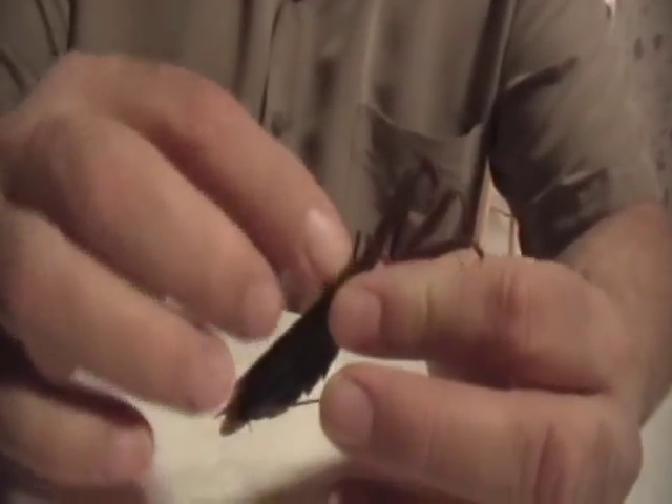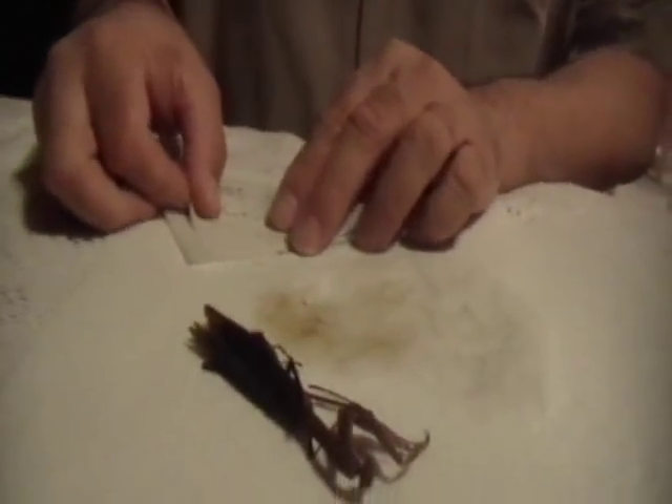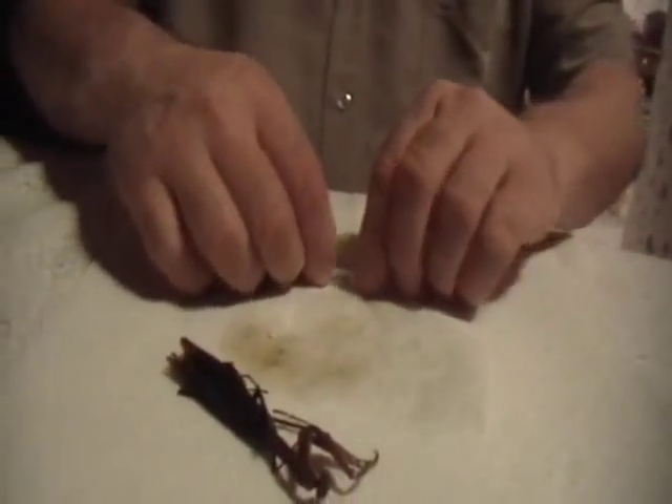And now I can handle it. I don't have to worry about it breaking. If I wanted to, I could put a pin right through it and it wouldn't break the appendages because they're no longer brittle. What I wanted to do was not pin it — I just wanted to be able to put it into this envelope and seal the envelope without this breaking, because this is the type of envelope I store them in before mounting.